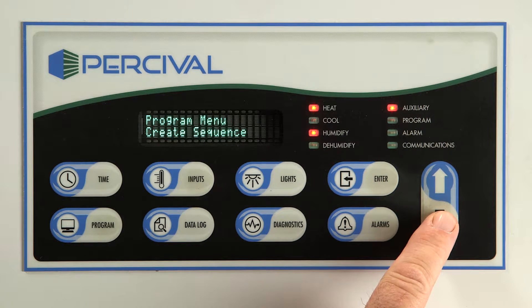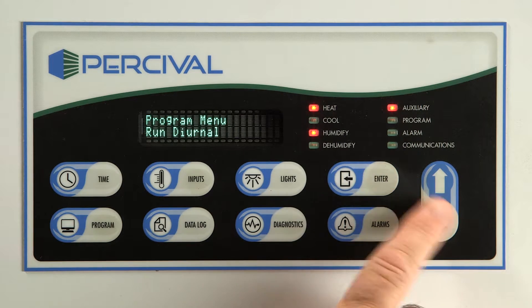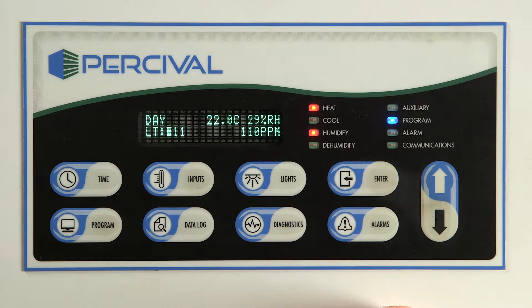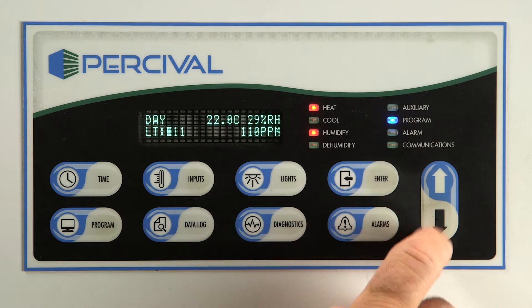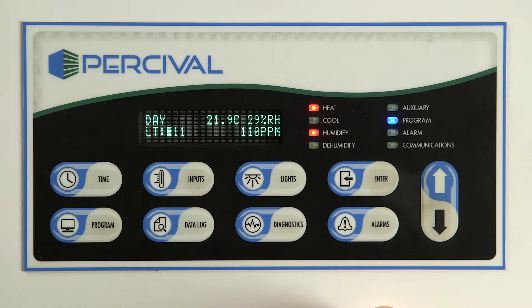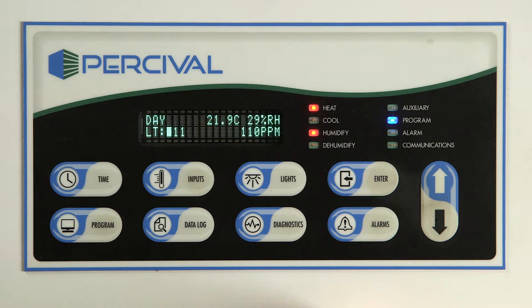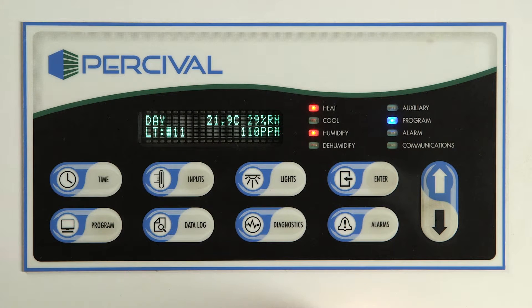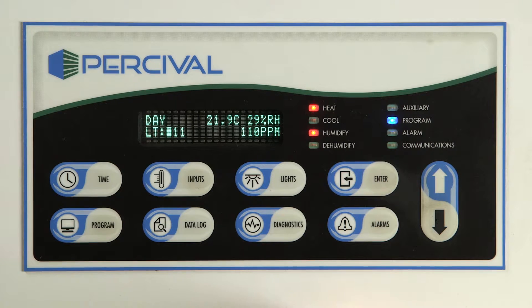Arrow down until you see run diurnal and press enter. You will now see the display say day or night and the indicator LED next to program will be illuminated. 2. Multi-step programming allows the creation of programs with a number of steps having different temperature, relative humidity, lighting, and CO2 set points.